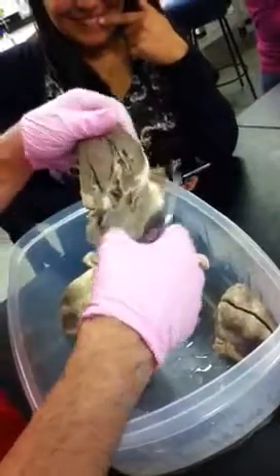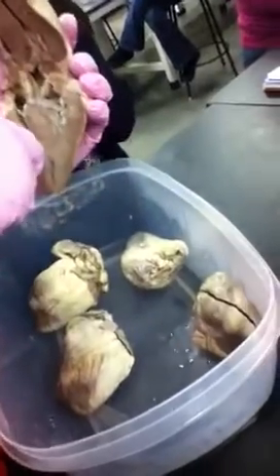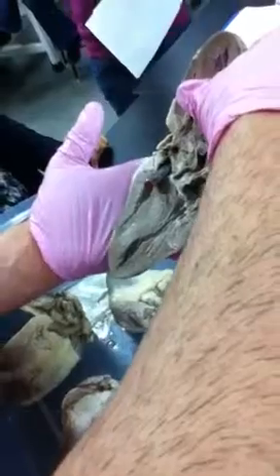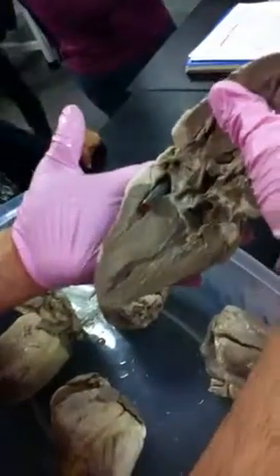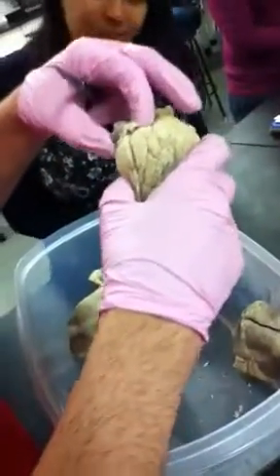Anything else on here? That's it. So here's a nice picture. You can clearly see this is the right atrium. So if I stuck this vessel in here and it's sitting there just like that, it's going into the right atrium, superior vena cava, or you could just put vena cava, right? Because we can't really tell if superior. So you just want to be able to distinguish that it's a right atrium from a right ventricle. And then little auricles, you'll have like a little tag on that? Yeah, so auricles would be these little guys right up here. Okay. These cute little guys. All right, next. Be careful.